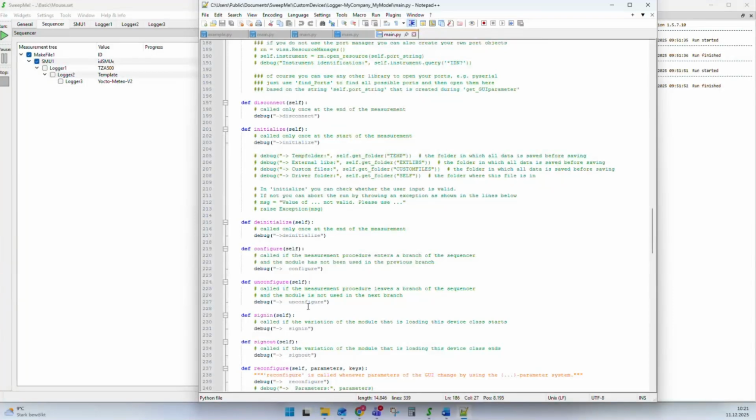So what we did is we found, for all the phases of a measurement, these semantic phases and functions that you have to do at some point. You have to configure your instrument at some point. You have to initialize. And this initialization, this configuration, is independent of whether you have a light source, an electrical measurement, or a wafer prober. You have to do something at this step. And by filling these functions at the correct position, you ensure that your instrument is correctly configured, initialized, and so on.